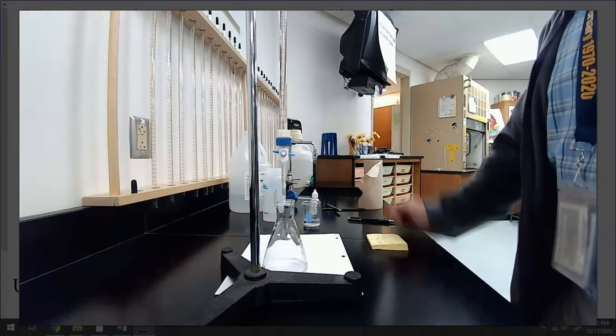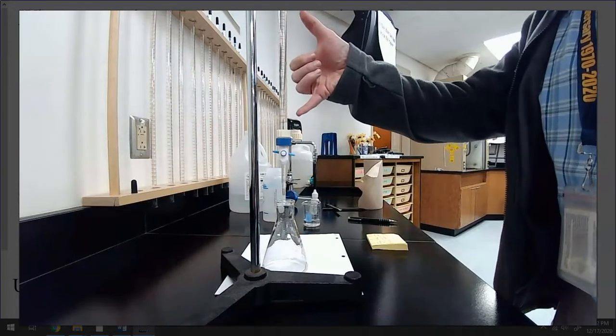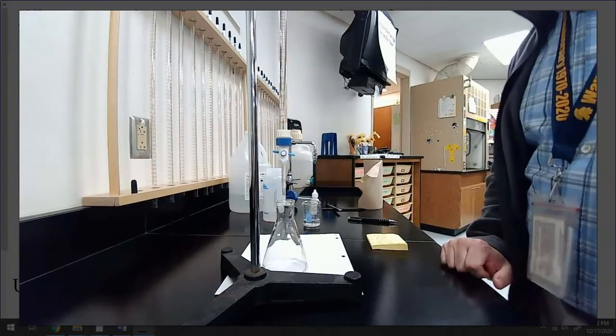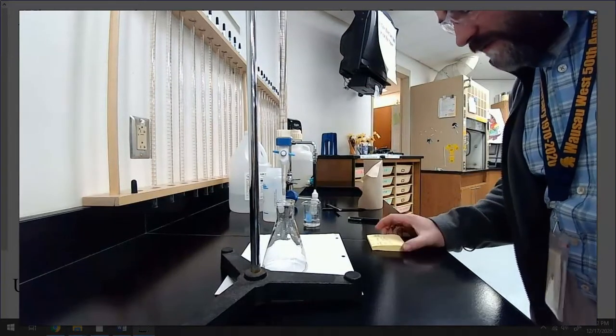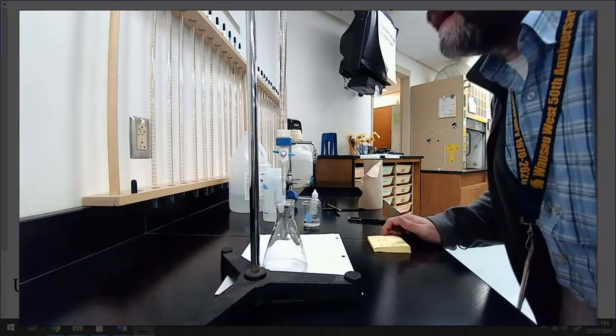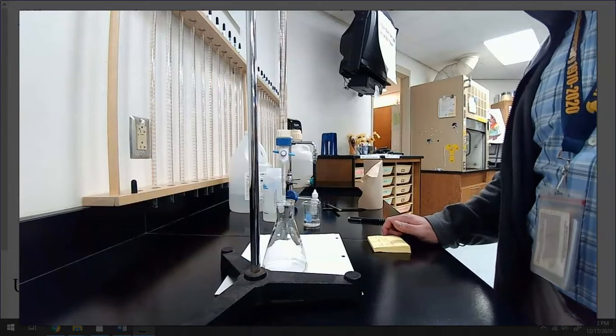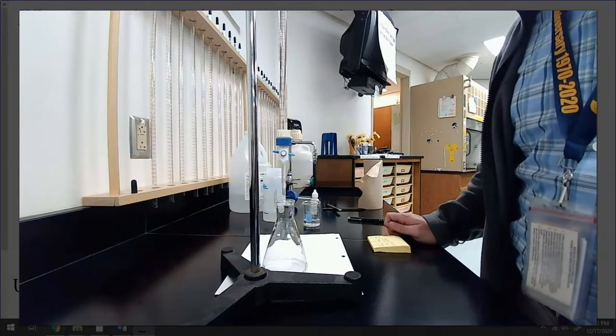Now, I still have a burette. I still have plenty in here. I'm not going to refill it. I'll refill it when it's getting close down to the bottom. So I'm starting at the same place I left off with the second trial of A. I have 29.39 milliliters in my burette as my starting point for trial 1 of unknown B. Here we go.